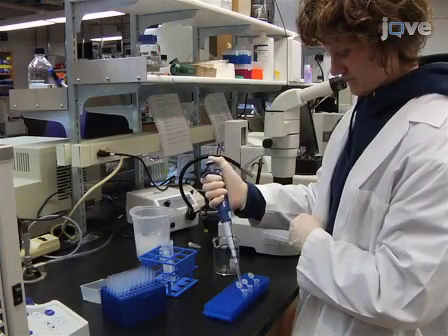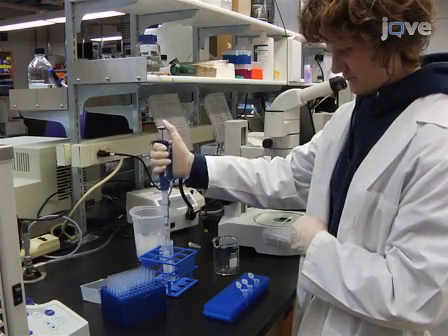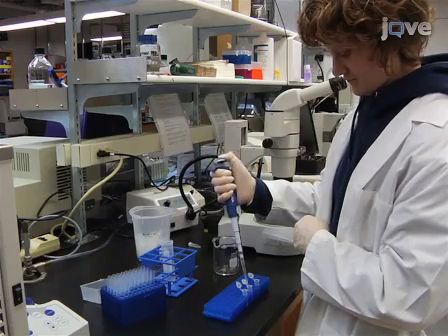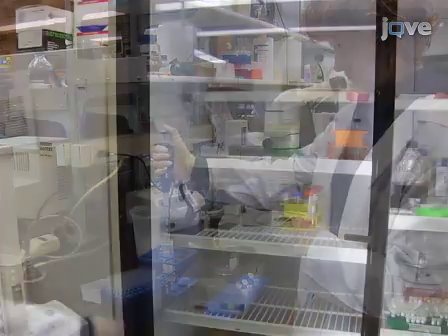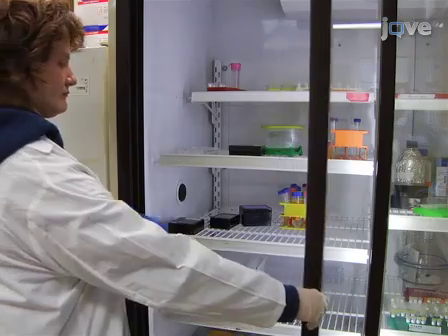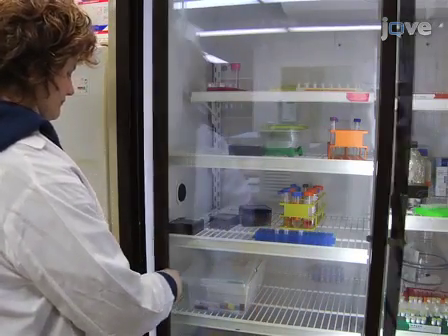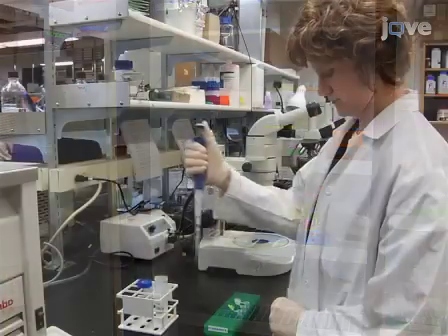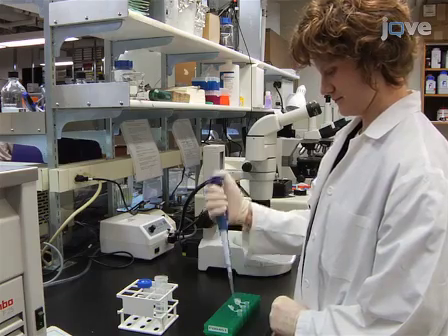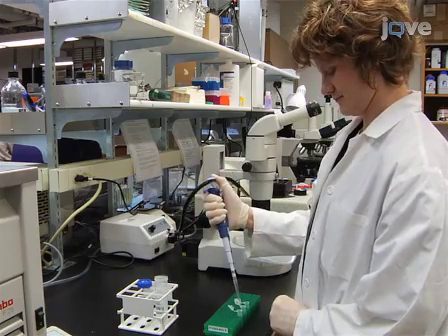After full color development, briefly wash the tissues with NT-MT containing Levamisole and then incubate them overnight at 4 degrees Celsius in PBS containing paraformaldehyde. The next day, bleach and wash the tissues. The sections are now ready for imaging.